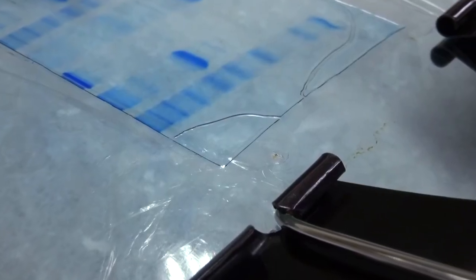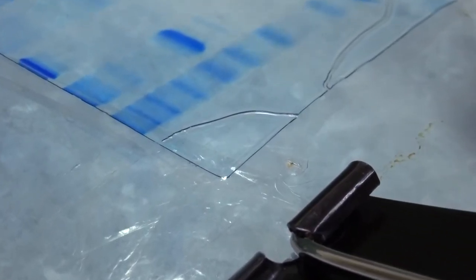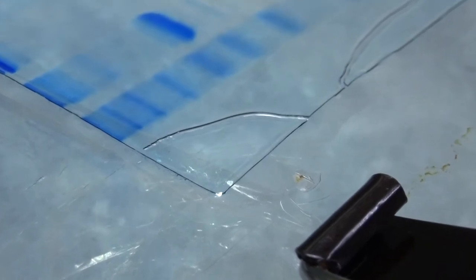Be careful not to cause bubble formation during the procedure, or the gel may break later due to uneven drying.